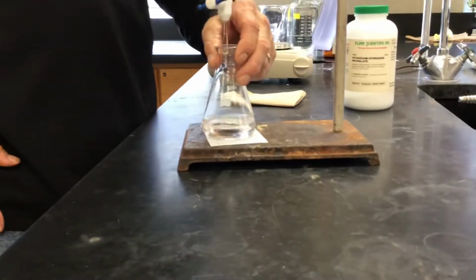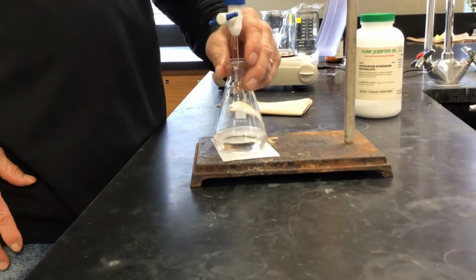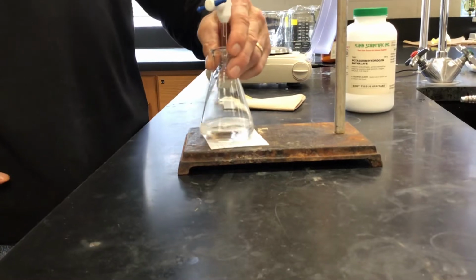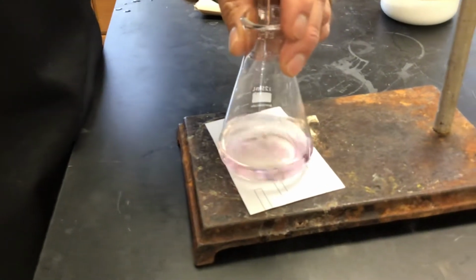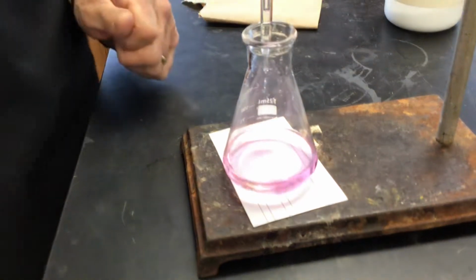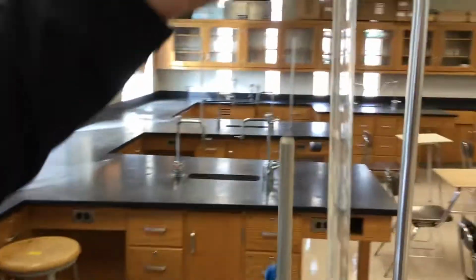If a student asks me my opinion, is there pink in there or not? I tell them, we'll get the volume and then add 1 more drop and see. If it turns to a brilliant pink color, then you were at the end. It looks like it has swirled away though. In this case, if you go 1 more drop, okay, let's try one more. Oh, that was fast. It's quicker than I wanted. Okay, there it is.